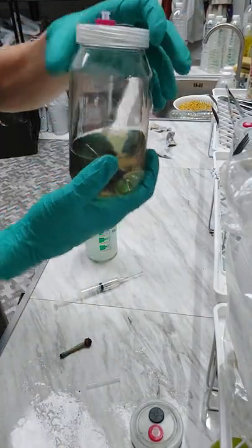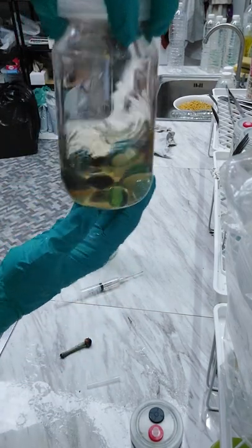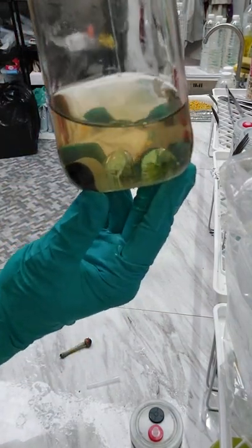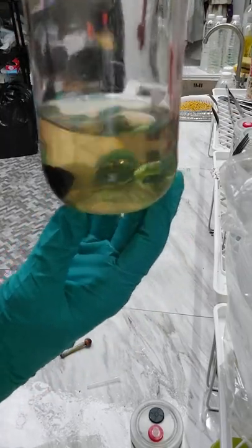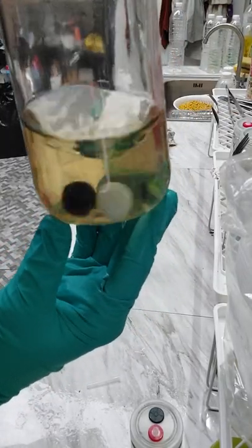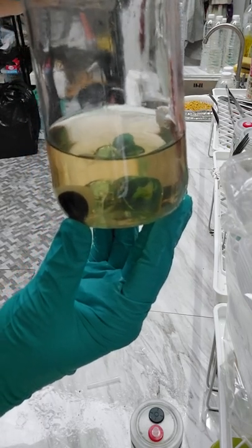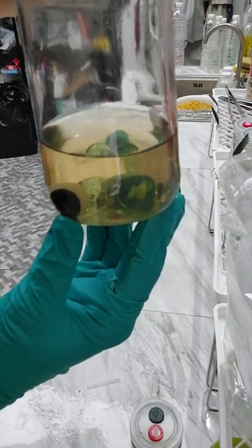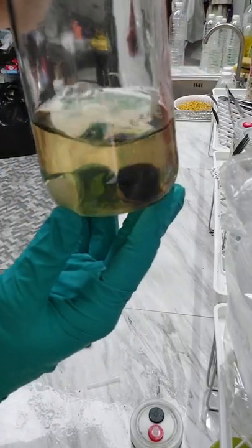Okay, so I'm done with that needle. And the reason why is because if you look down there at the bottom — I don't know how well you can see this — but there's a little chunk floating in there. That is a biopsy. If you look real close, you can see there's a little chunk floating around in there. There is a chunk, believe me — there's a little tiny chunk.